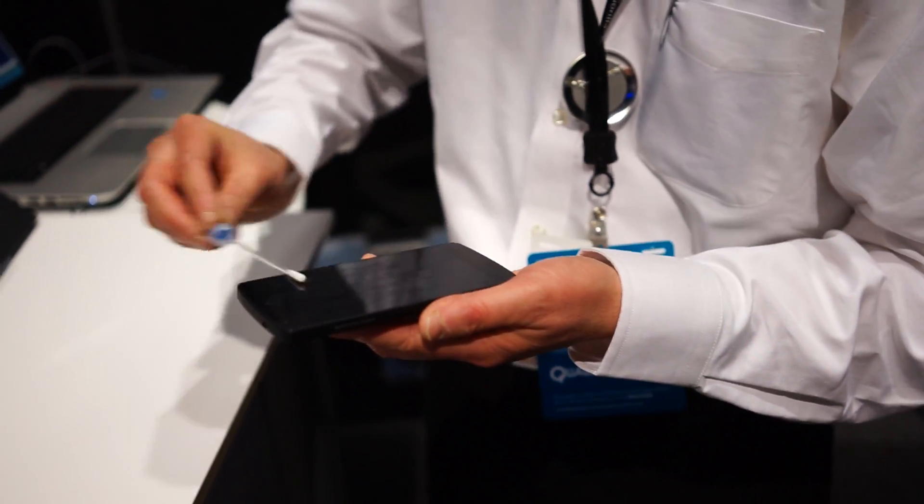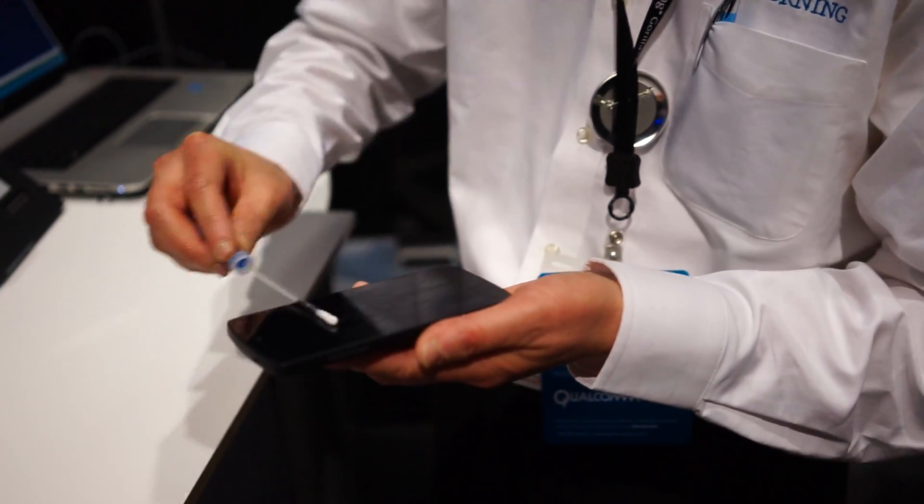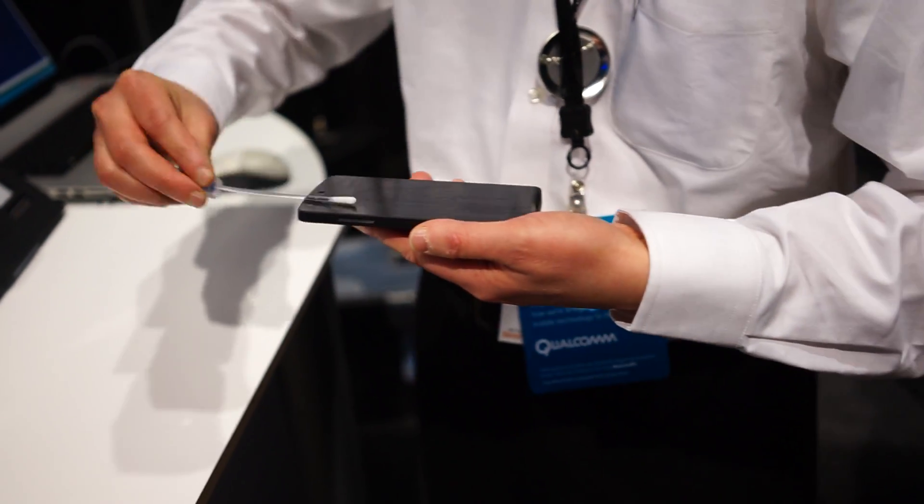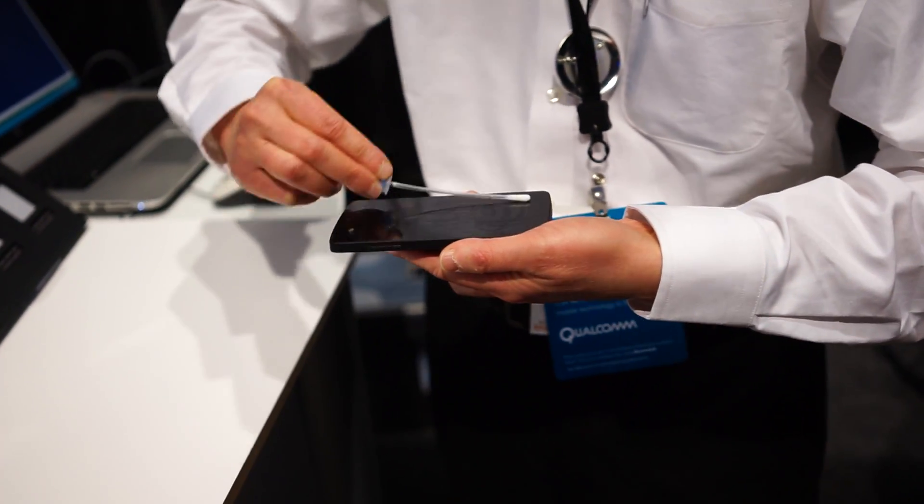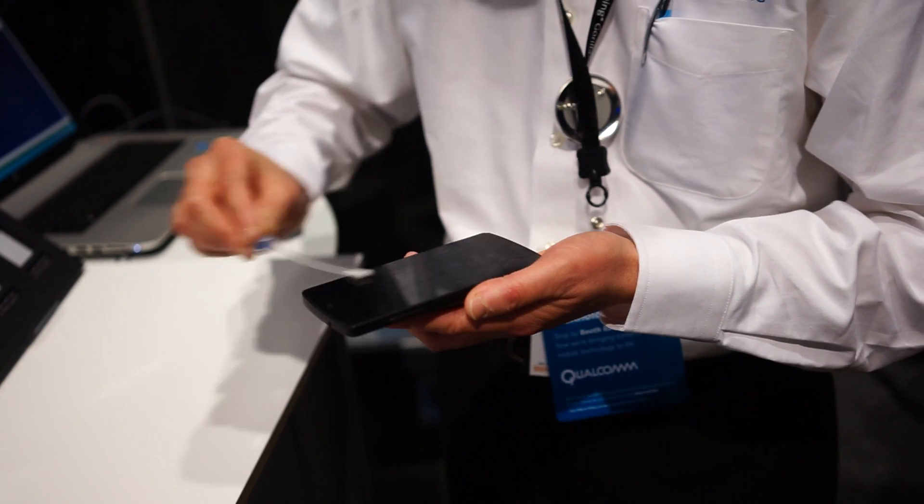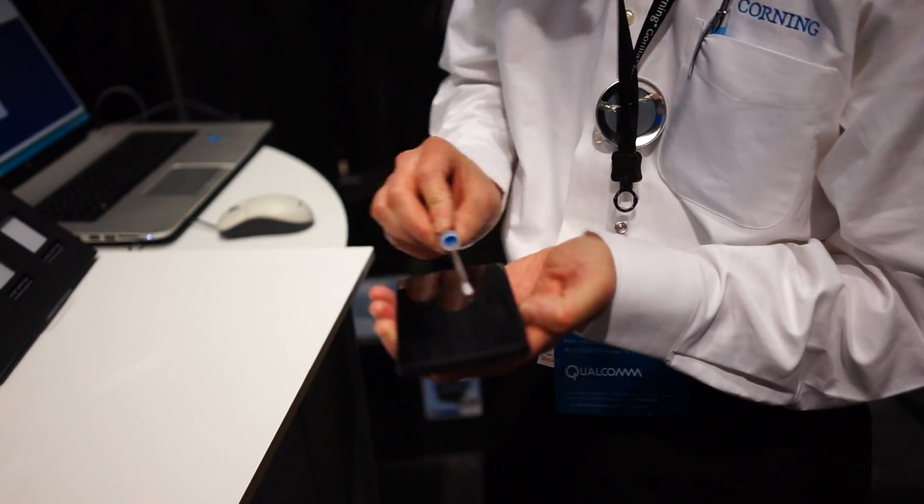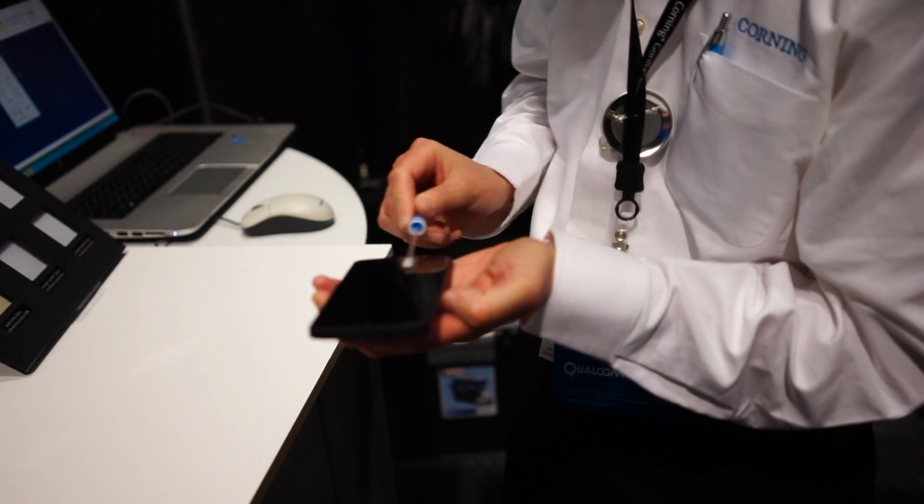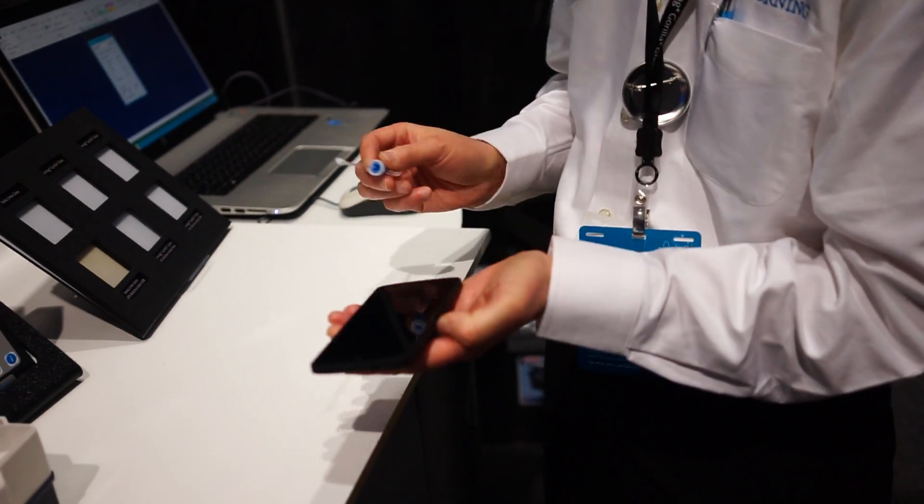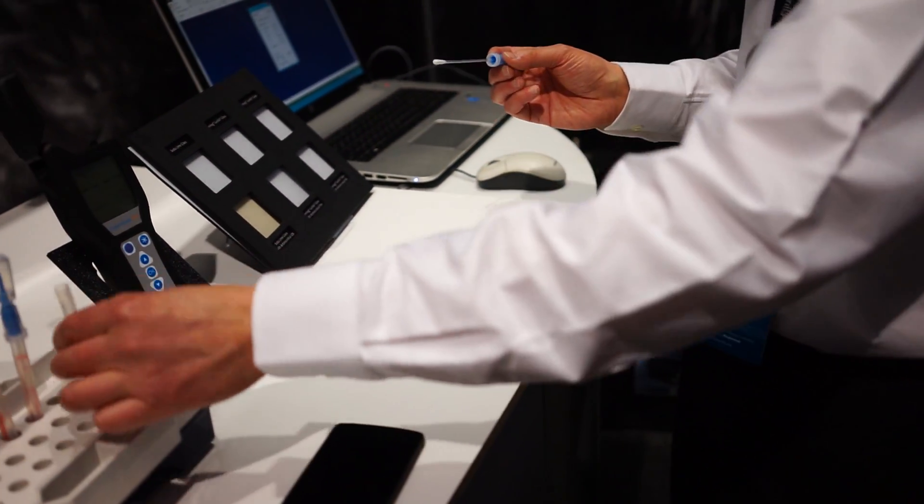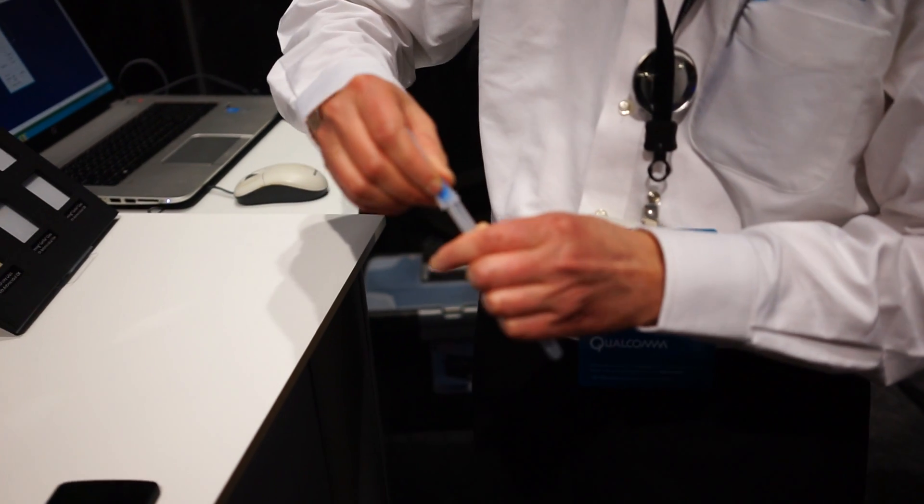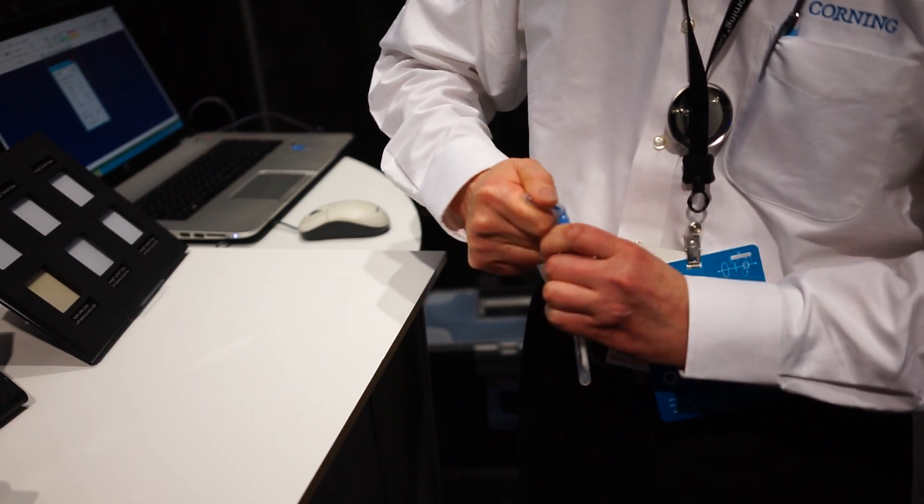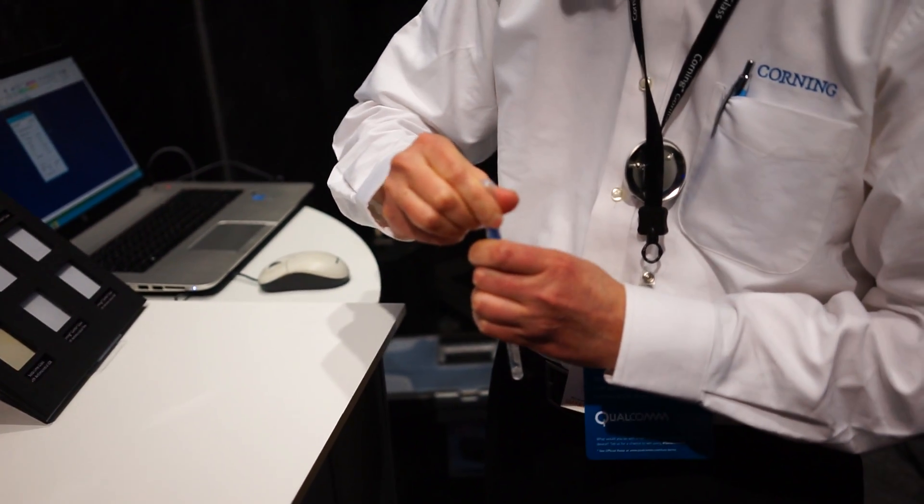I'm pretty sure there's no bacteria on my phone though. Well, we're going to find out. This should be interesting. This is not going to help my OCD at all. All right, so the swab is done. I put the swab back in the tube. I really didn't know. It was nice and good. Wow.